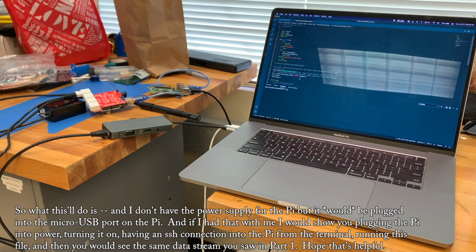And if I had that with you, I would show you plugging the Pi into power, turning it on, having an SSH connection into the Pi from the terminal, running this file, and then you would see the same data stream you saw in part 1. Hope that's helpful.